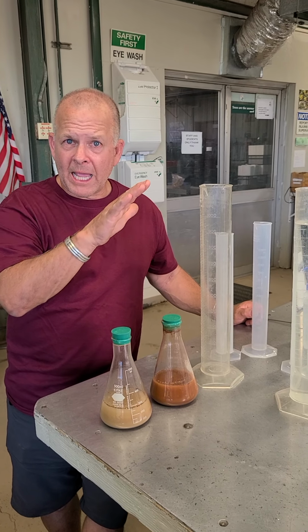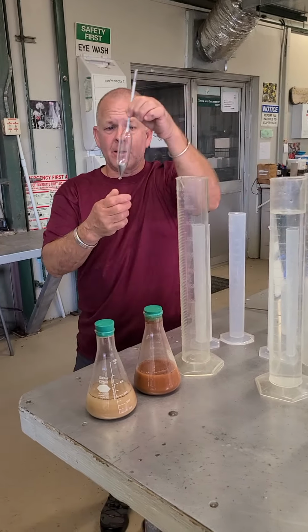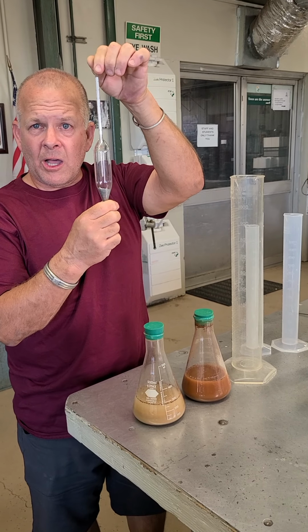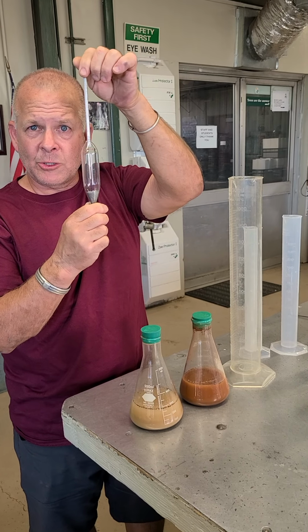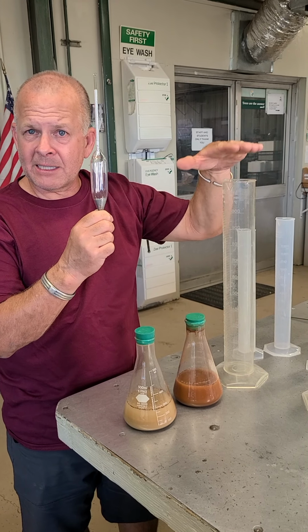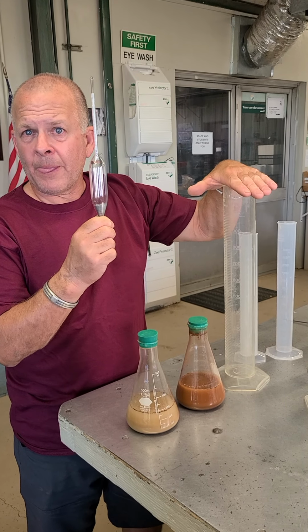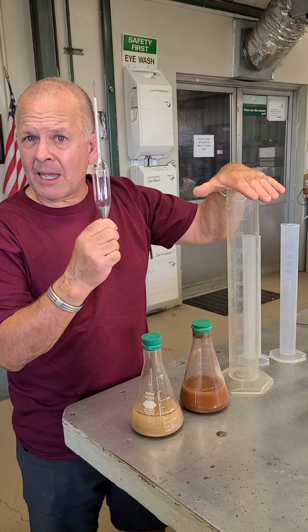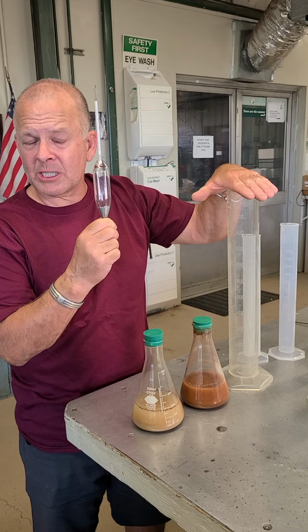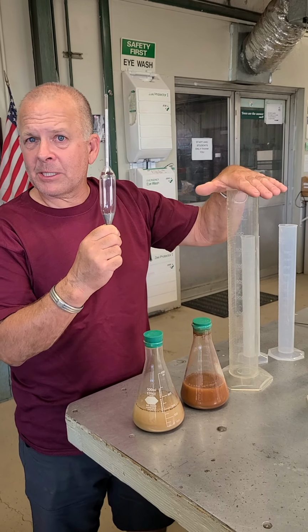using that equation, we can use the hydrometer, this device right here, which measures density of solution. If we use Stokes' law and this hydrometer, and we take measurements in our solution of known density at exact times, then we can calculate the density of our solution, and we can equate that to the size of particles that have fallen out of suspension. You'll see what this looks like in real time, if you will. But that's the principle behind what we're doing.